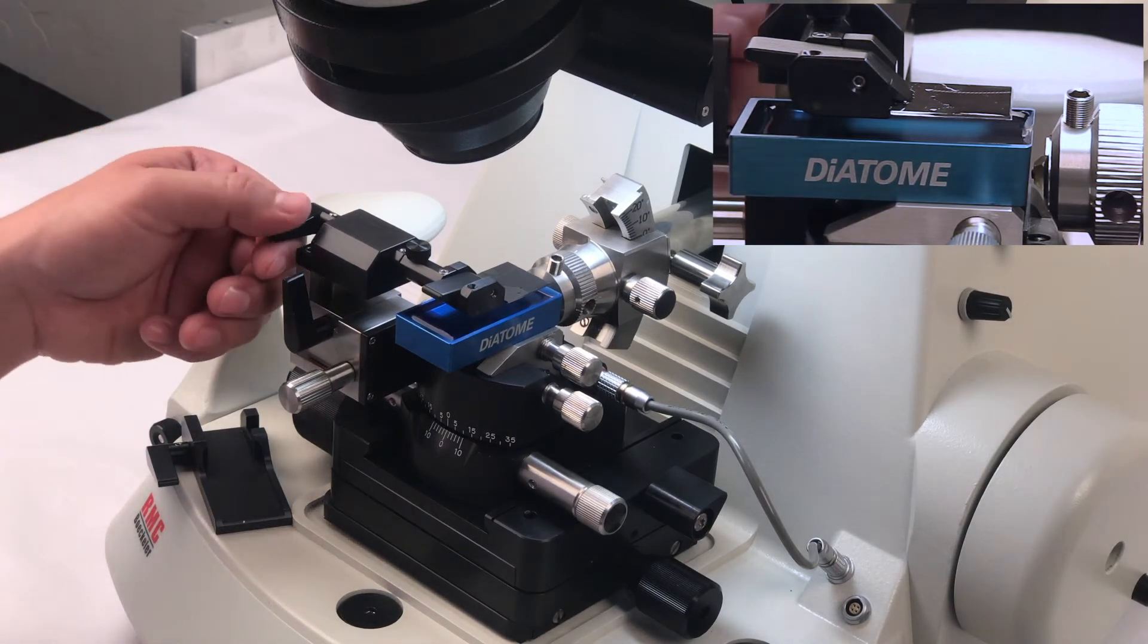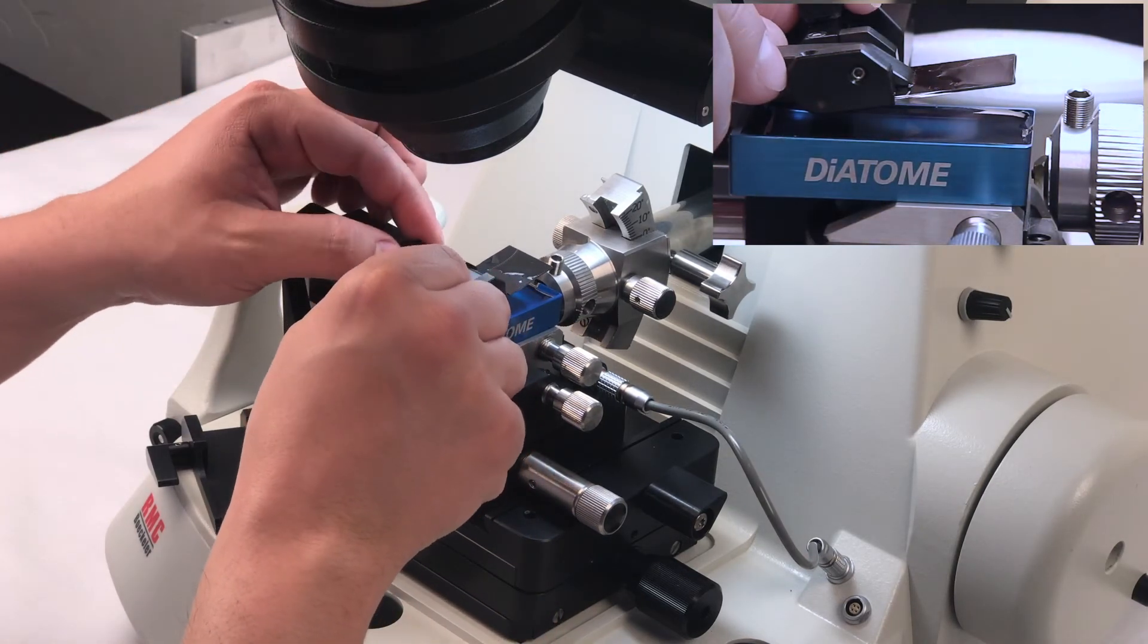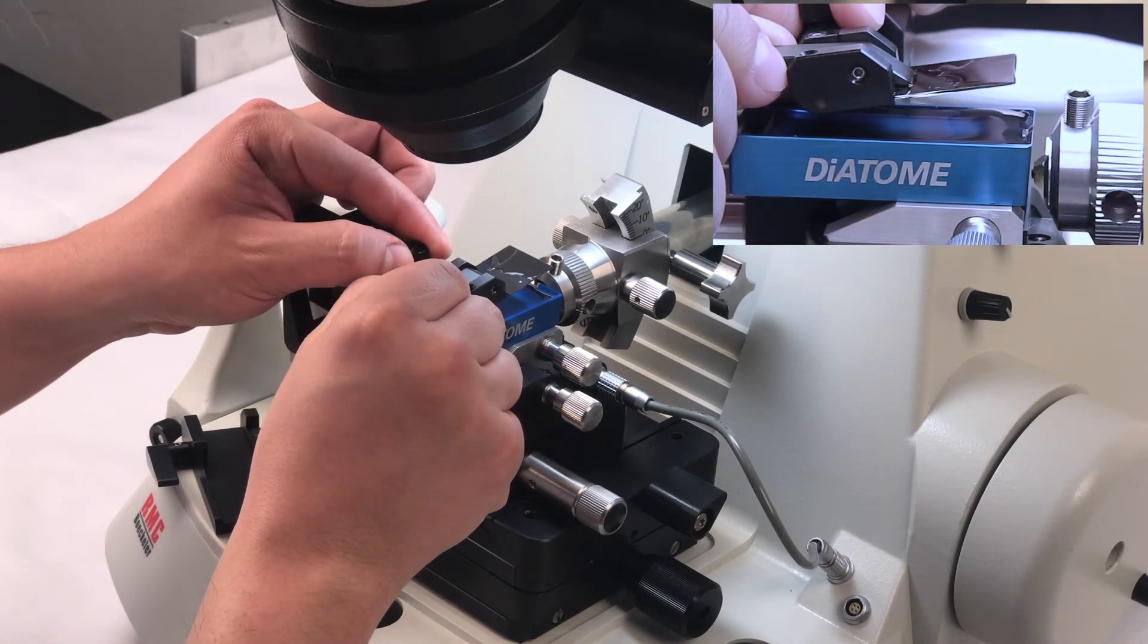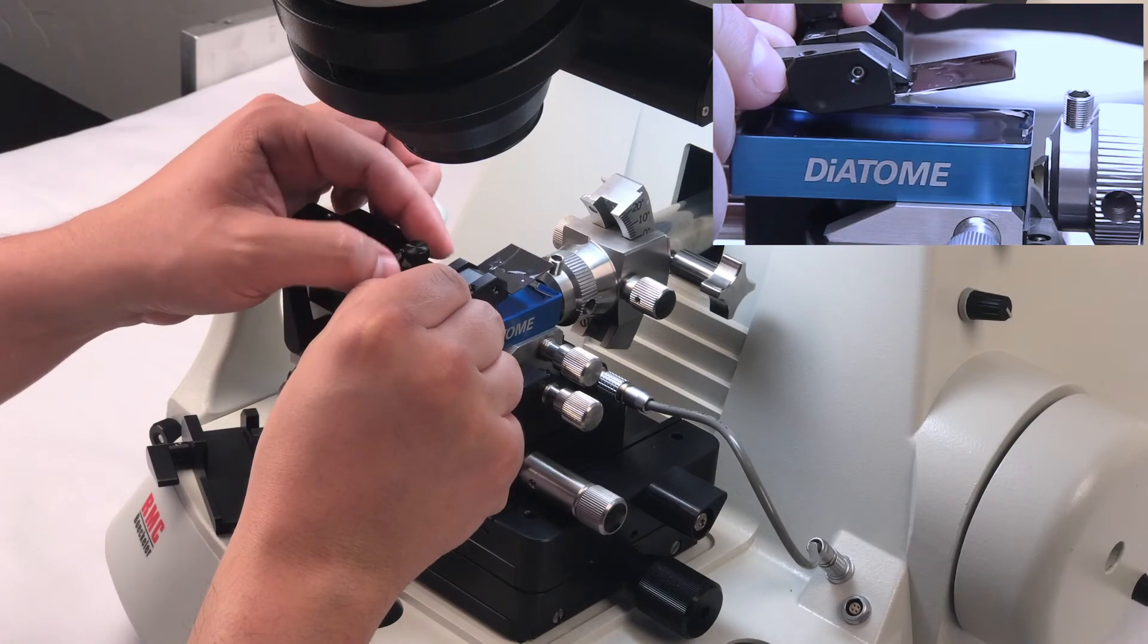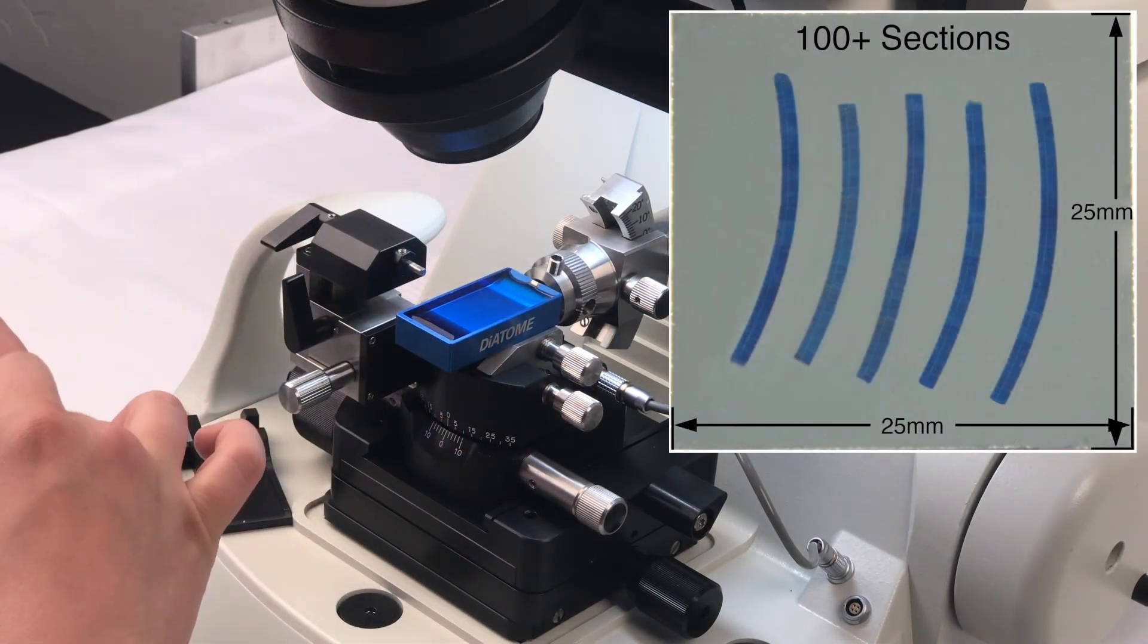At this point you're ready to remove this substrate clamp. So simply loosen it and place it onto the loading tray.